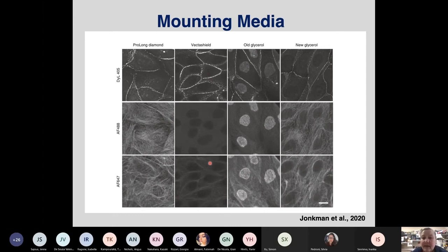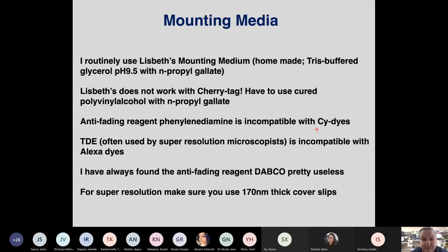Now, I don't know what happened to old glycerol. Old glycerol was one of the bottles that I had standing around. Old glycerol has a dramatic problem because old glycerol has some nuclear background in all channels. So that's very, very peculiar. Whereas new glycerol is almost as good as ProLong Diamond. And I don't like spending money on commercial products if I don't have to. So for mounting, I use new glycerol with N-propyl gallate to mount my sample, so it's homemade stuff.